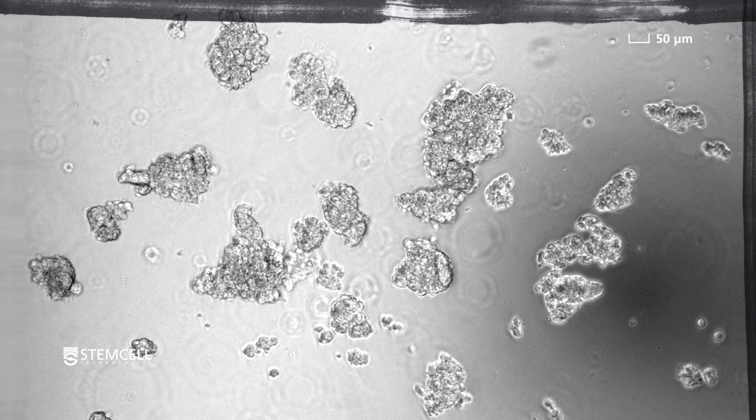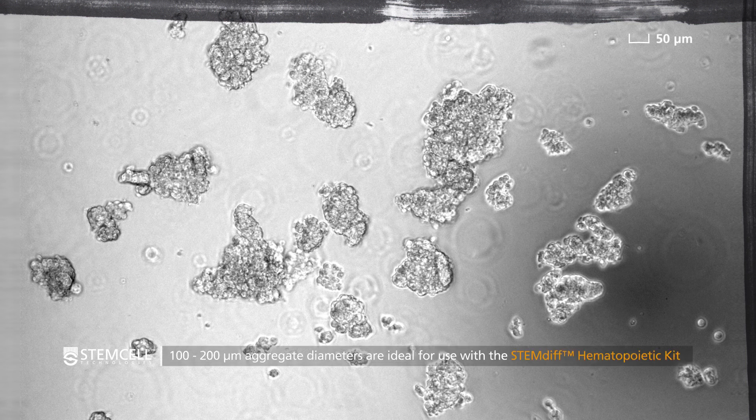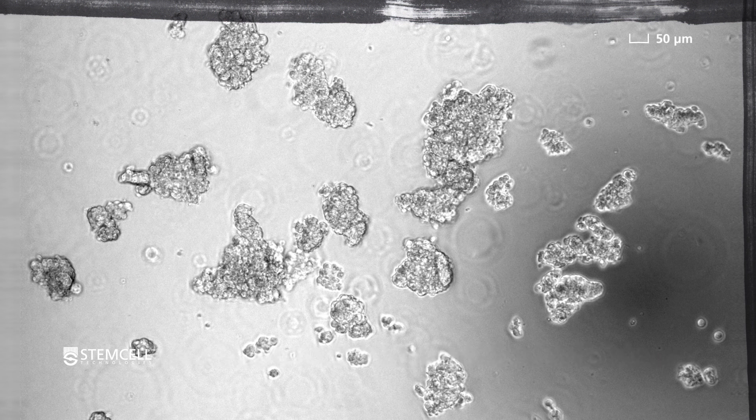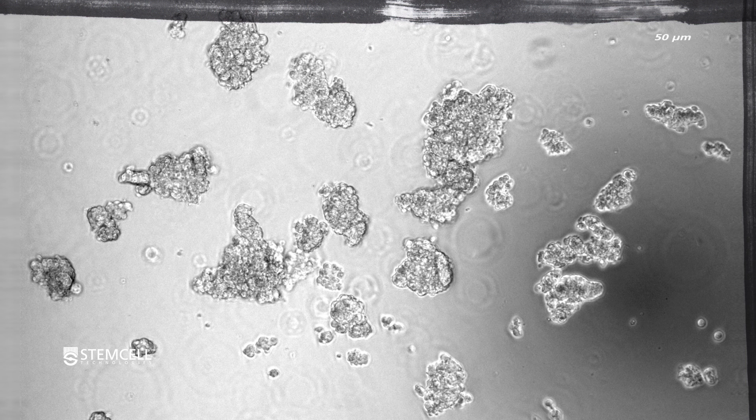Aggregate diameters ranging from 100 to 200 micrometers are ideal for use with the StemDiff hematopoietic kit. However, count any aggregate greater than or equal to 50 micrometers in diameter, since these are also likely to grow into colonies.